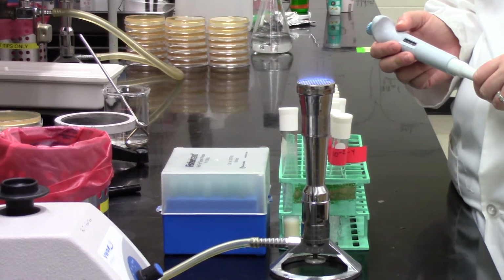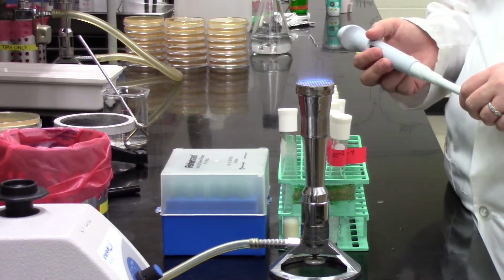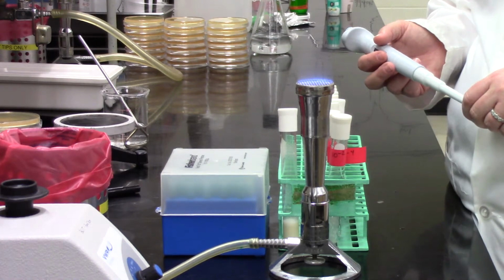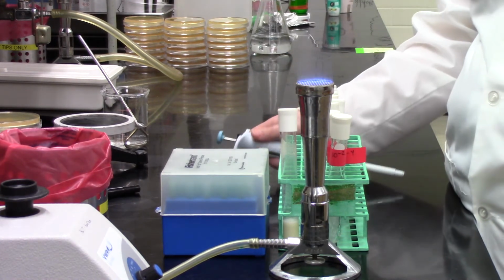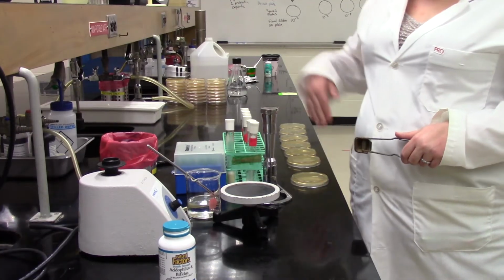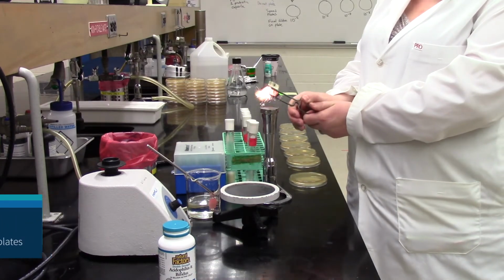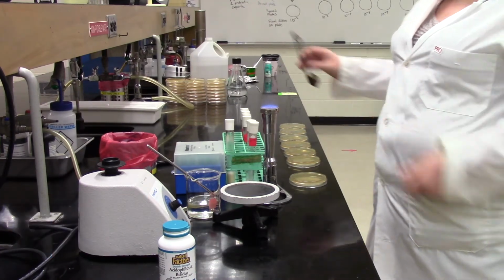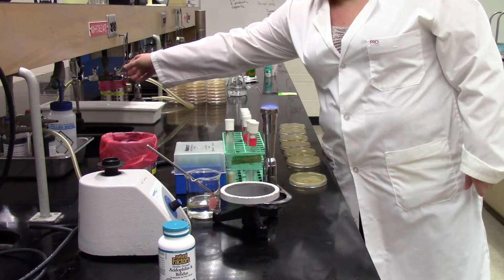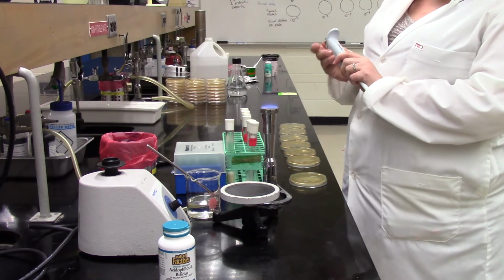We've got all our samples ready, and this is actually where you logically could take a break because you've prepared all your dilutions, and then we'll come back, mix those dilutions again, and show you how to make the spread plates. Hi guys, we're back again to finish off this spread plating of our diluted probiotic sample, our natural factors probiotic capsule that we diluted out.